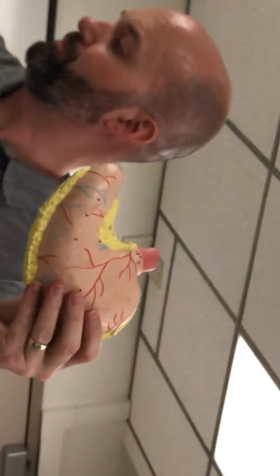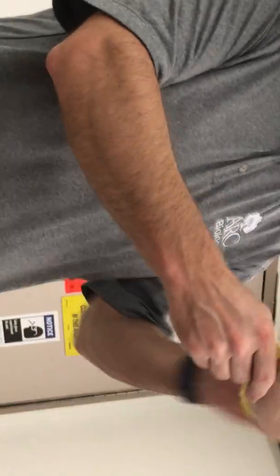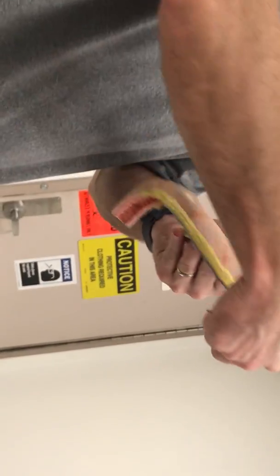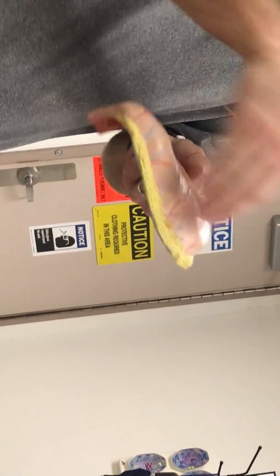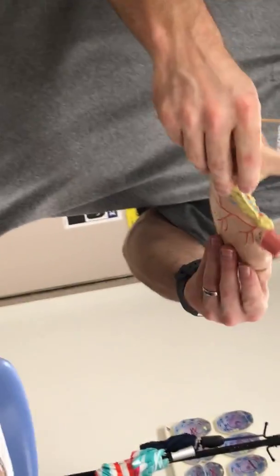All right. Organ? It's a stomach. Oh no, that's the stomach. And the yellow here, what goes... Lesser omentum. It is adipose, but the mesentery is called the lesser omentum. And then this is the greater omentum, which has been cut. And this outer part is the greater curvature and the lesser curvature.